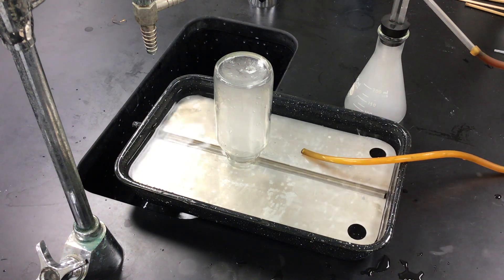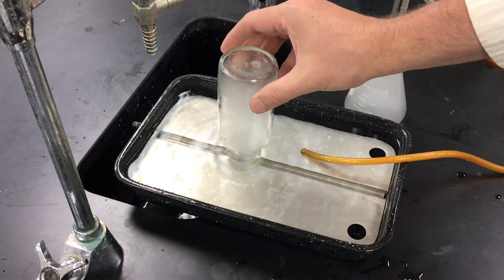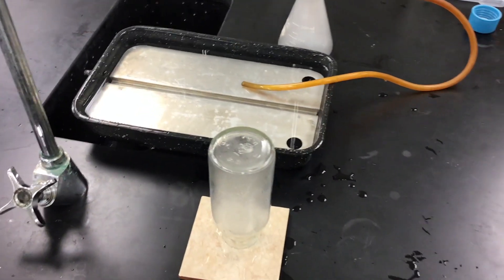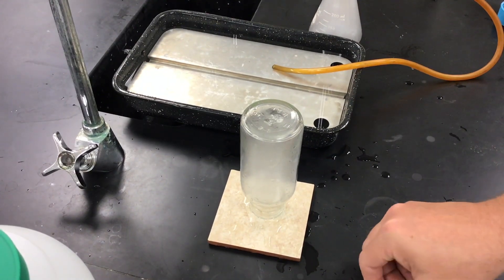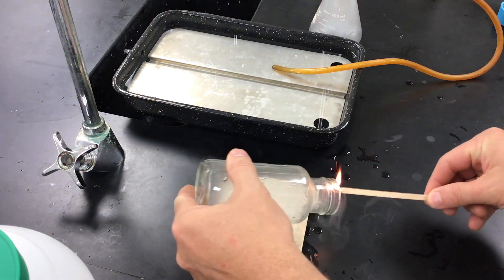To test whether we have hydrogen gas, we're going to create a small flame using a wooden splint. I'll quickly take the bottle off the trough, get a wooden splint lit, then lift up the jar and see if there's hydrogen gas. If there is hydrogen gas, a couple of things might happen — it might make a loud pop, or there might be a flame shooting out of the bottom, but it will make some type of sound.